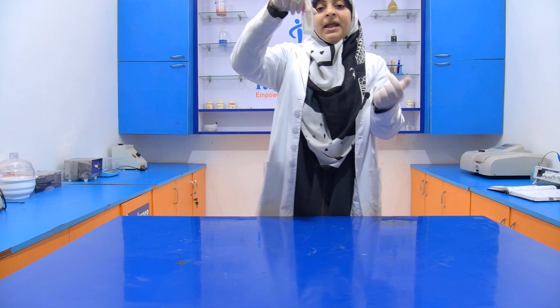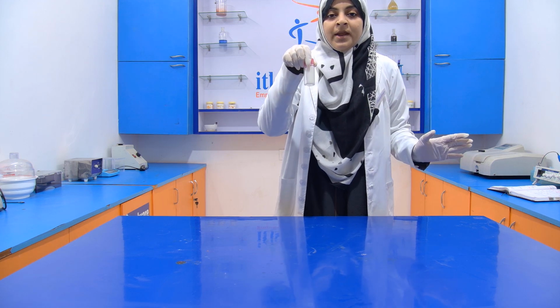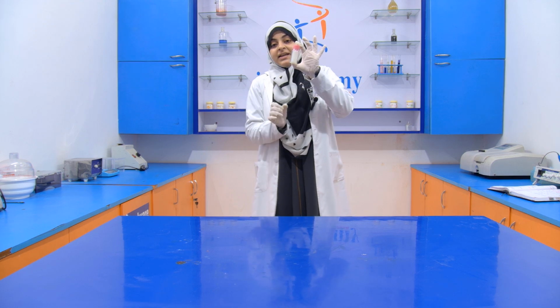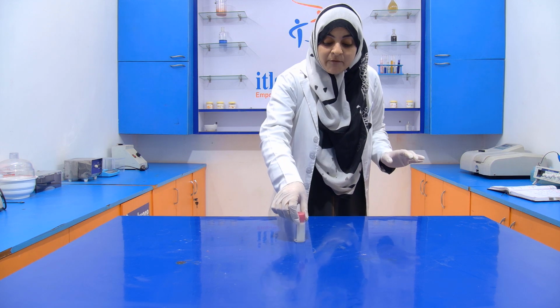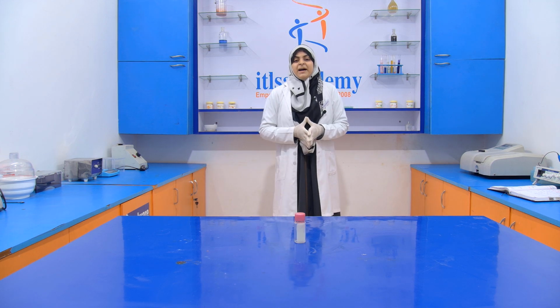If it is adulterated with other ingredients, then this layer is not completely solidified. There would be some oil mixture, but here you can see that it is very clear. The whole layer of the coconut oil is solidified, which means that our coconut oil is not adulterated. It is pure.